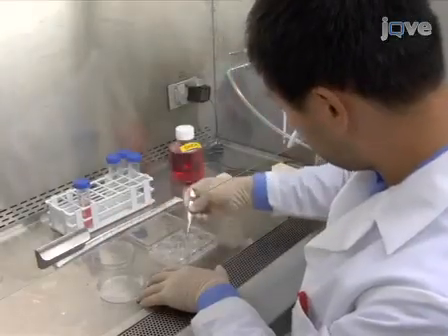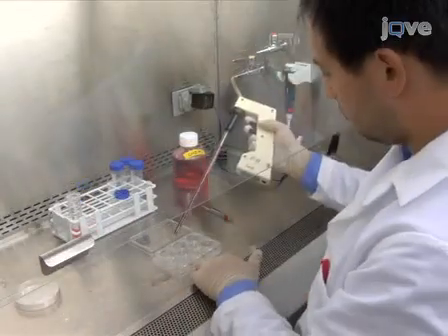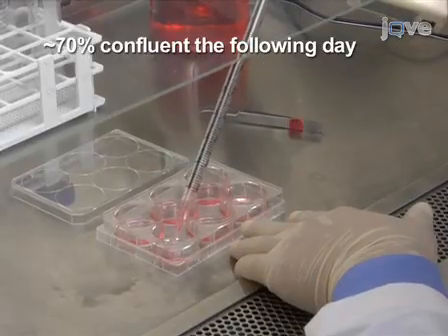To begin the protocol, plate HeLa cells the night before transfection on sterile glass cover slips placed in a standard 6-well culture plate at a density that will be approximately 70% confluent for transfection the following day.